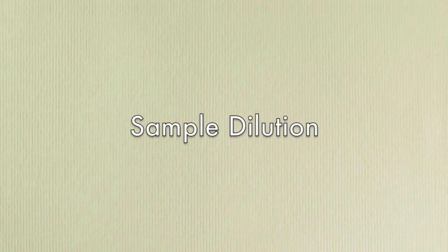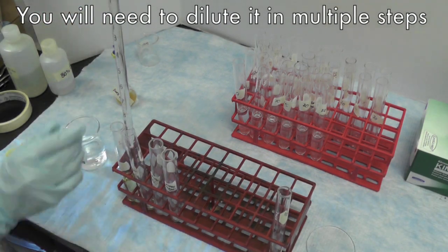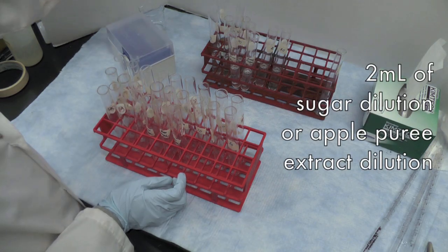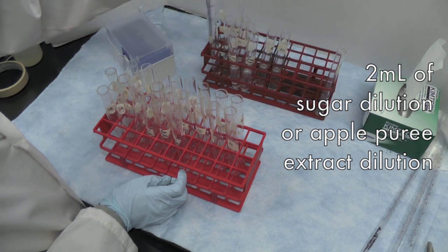Make 2 different dilutions, each of 10 ml, of the filtered apple puree extracts with DD water in triplicates, according to your pre-lab calculation. Vortex to mix well. Pipette 2 ml of each standard or sample into a clean test tube. You should have a total of 24 tubes.